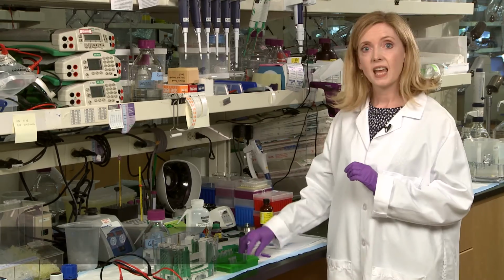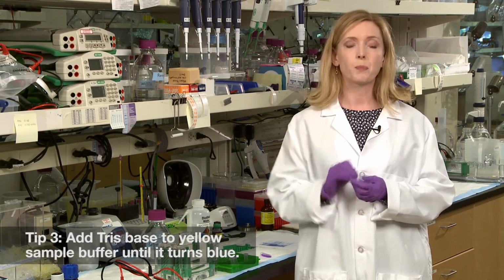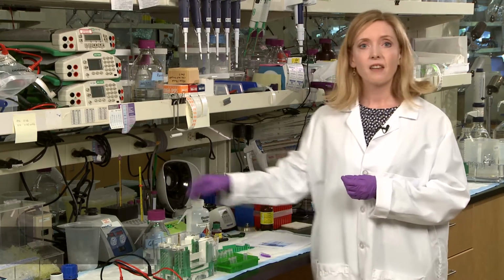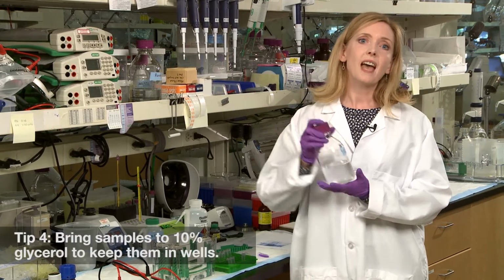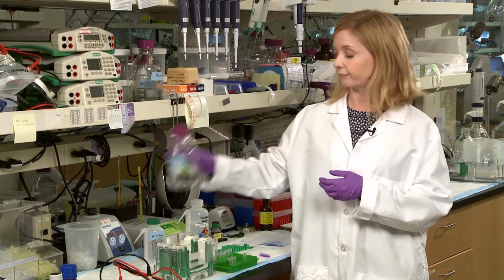Tip three, if when you add a sample to your sample buffer it turns yellow, add Tris base until it turns blue. And finally, if the sample floats out, add 10% glycerol to make it denser than the surrounding buffer.